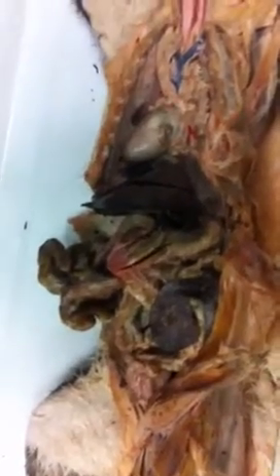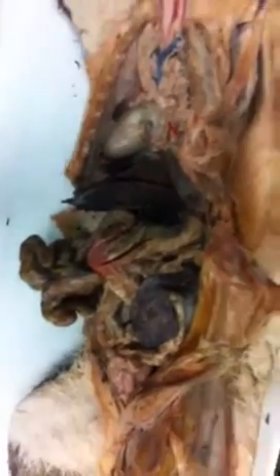And if we microscopically looked at one of those villi, it has a whole bunch of little projections on it called microvilli. And that's to increase surface area. If you were to take all of the villi and microvilli in the human small intestines and lay it all out, you'd be able to cover a tennis court. That's how much surface area you have. The more surface area, the more absorption, the more efficient your absorption is.